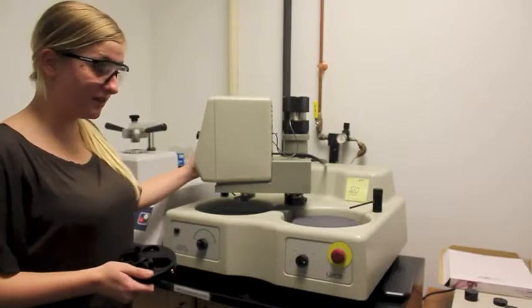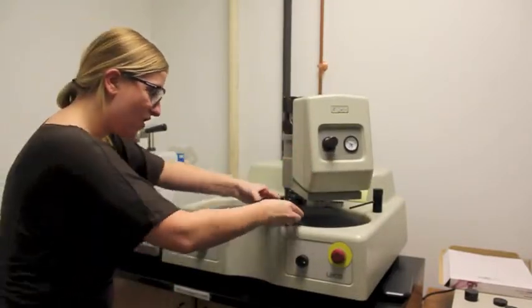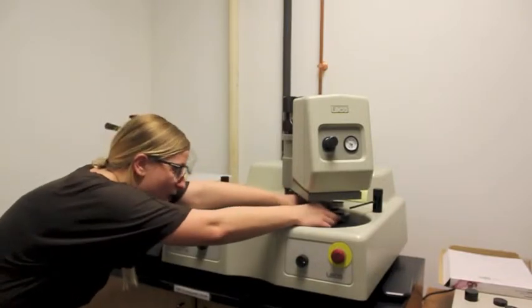You must first rotate the polishing head all the way, place your sample mount on the table, and align the center of the mount with the center of the polishing head.